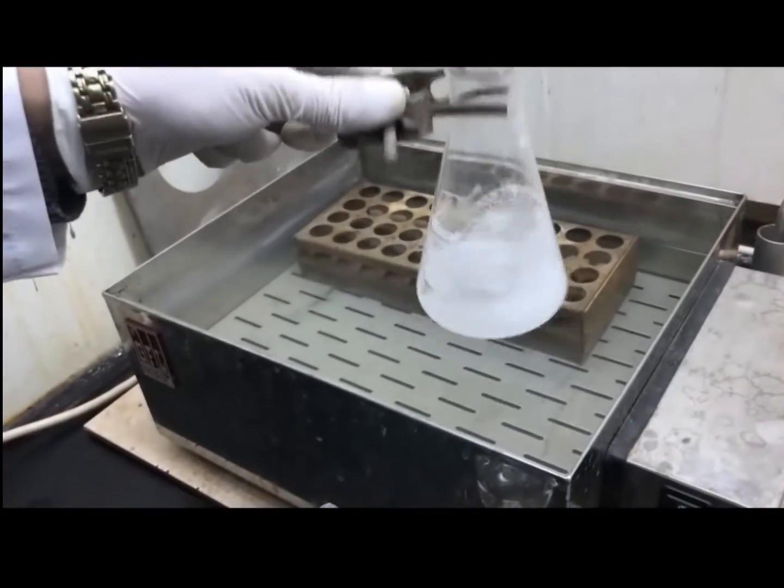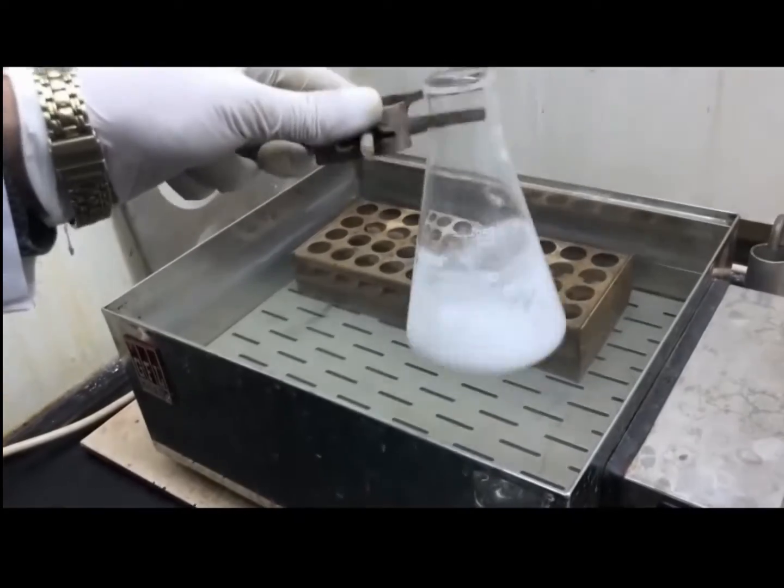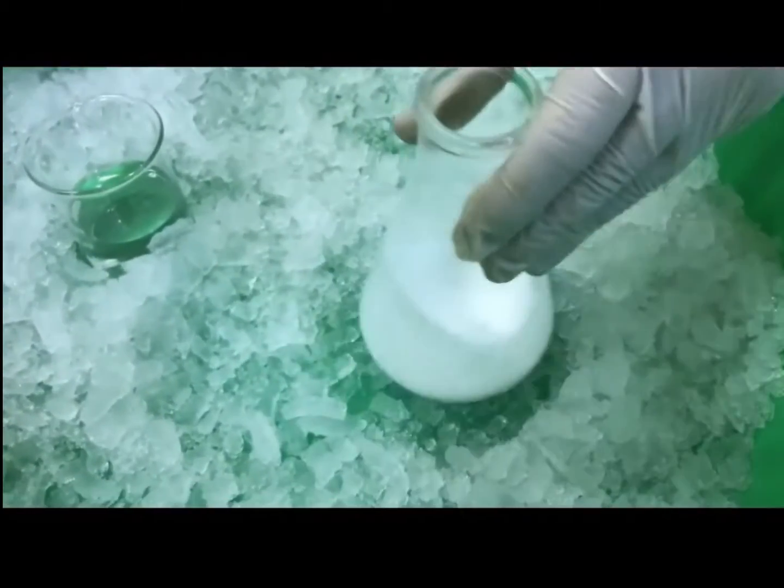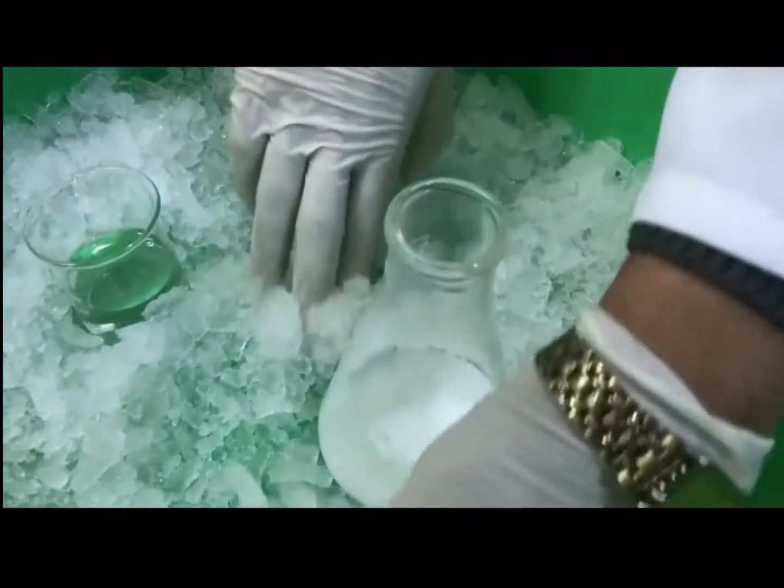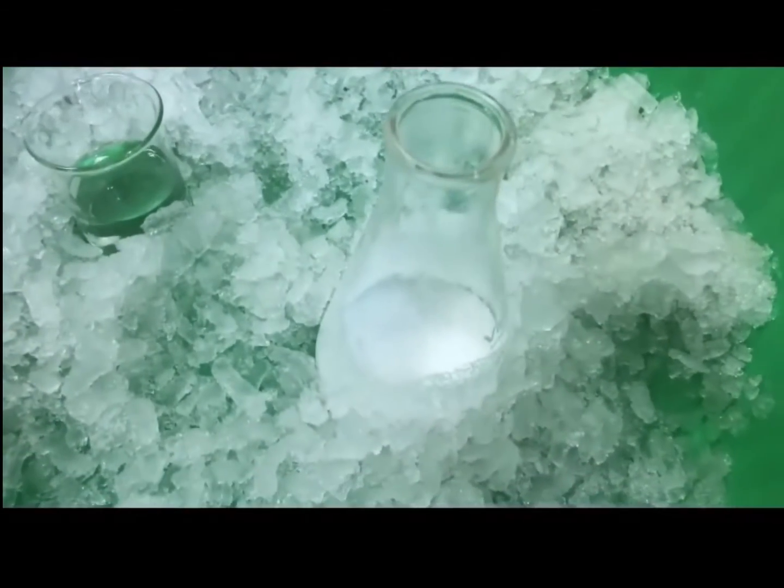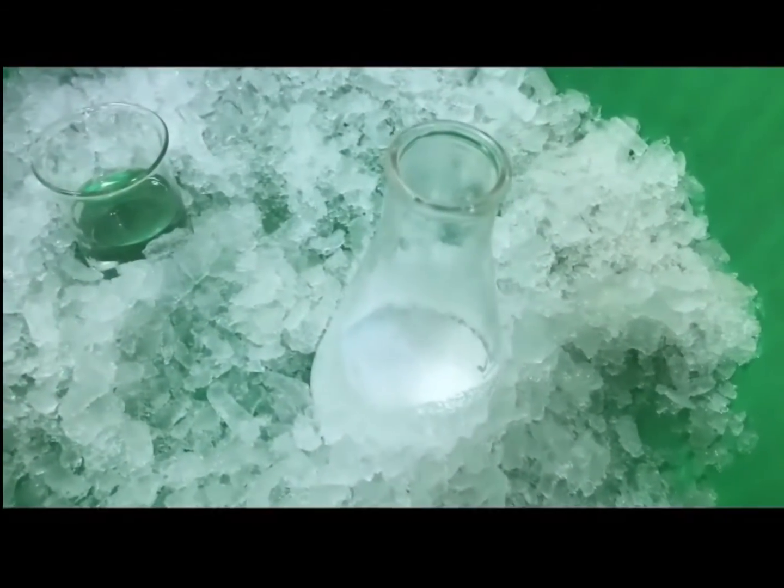Now we will cool it in an ice bath for 10 minutes. After putting it in the ice bath, you can see that the product has already formed. There is no need to use a glass rod.